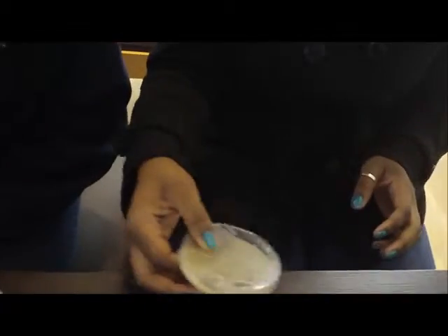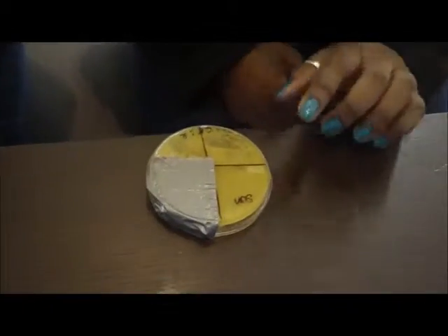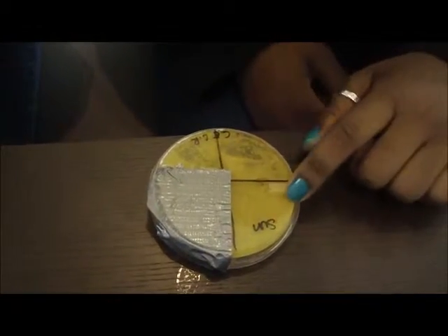What we basically did, we put the yeast in here and then distributed it evenly. Then we labeled the back and we had one place that says sun, and here there was no sunscreen.